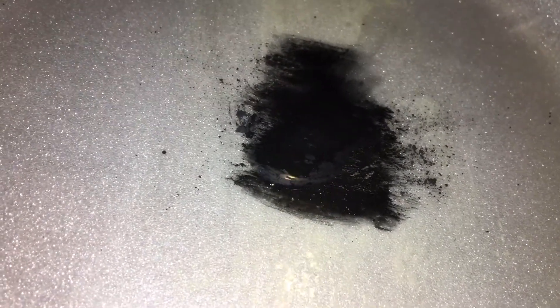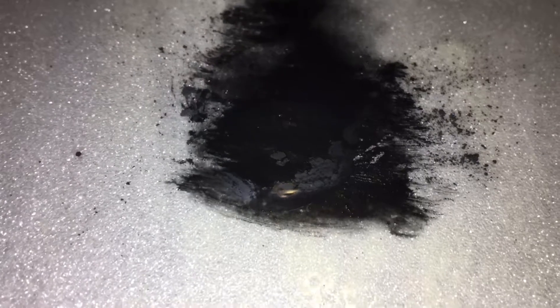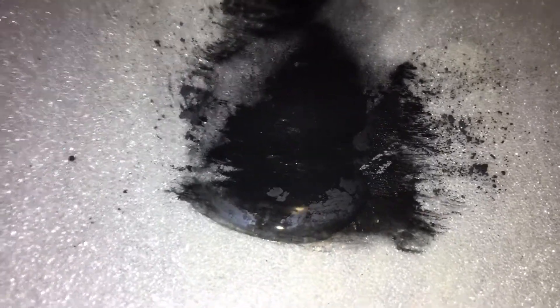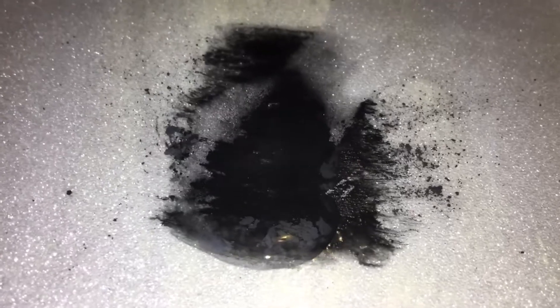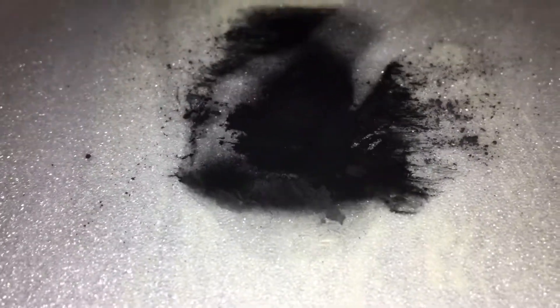See that film at the very top? Those are actually pieces of graphene. If I get closer, you can see them right on top — those are pieces of graphene floating there. They're pretty big pieces too.